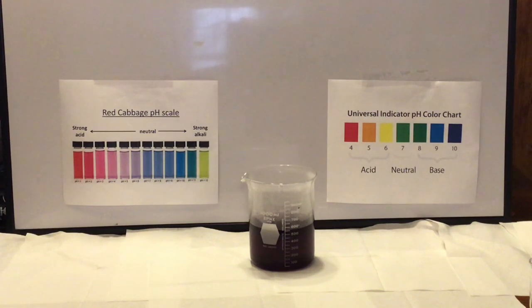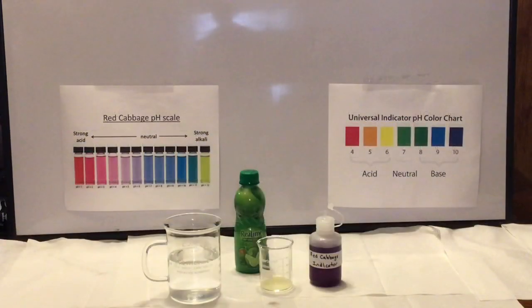And so what I've done is I've taken red cabbage leaves, added them to a beaker with some water, and then heated that. You can see the steam still coming off of that until I get this nice pretty purple color. Again, I'm using deionized water here that's purified. And so we're going to take that solution and add it to a bottle, and then we're going to add that to the different household substances that I went around the store picking up that were virtually colorless. So we're going to start with lime juice, and this is the first one that we did.